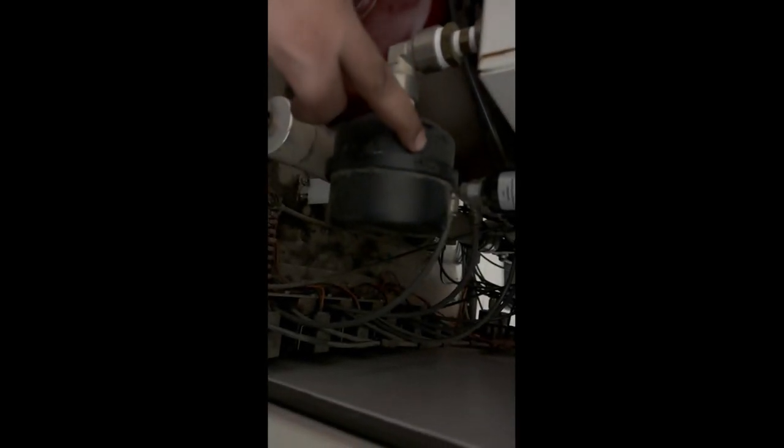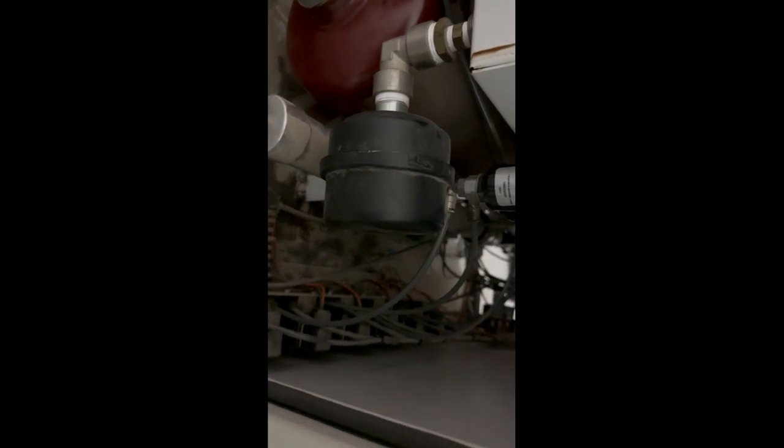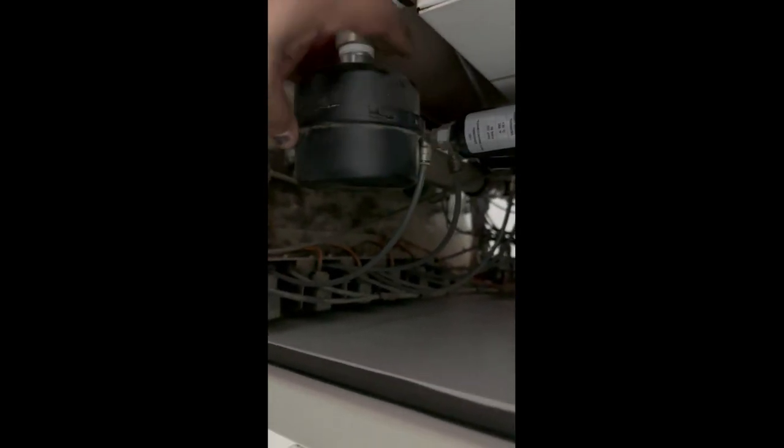Here you can see we have the filter dryer for air, and beneath it this longer part, if I can zoom it for you, is the membrane, and this is your exhaust. On this side, this is the suction port, meaning all 3 compressors have the same suction. The air is being sucked through this filter, and here we have the membrane.